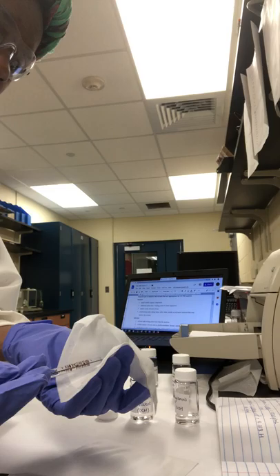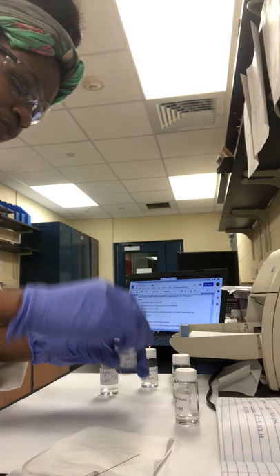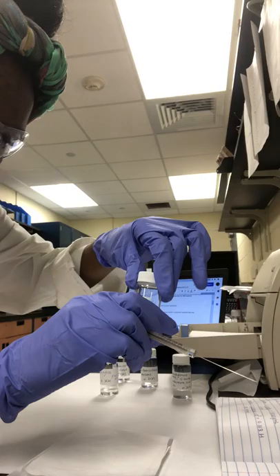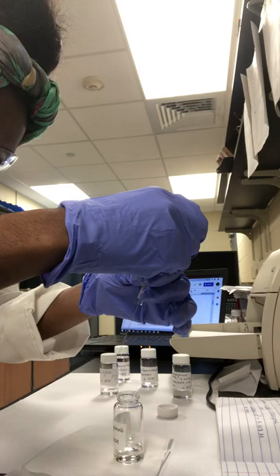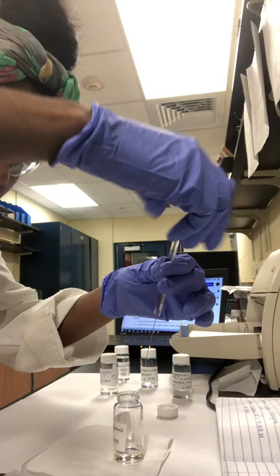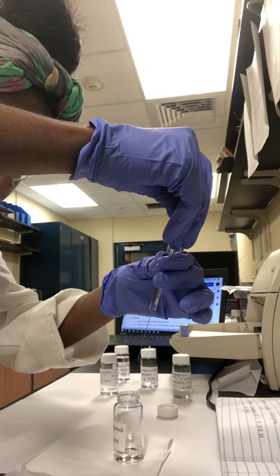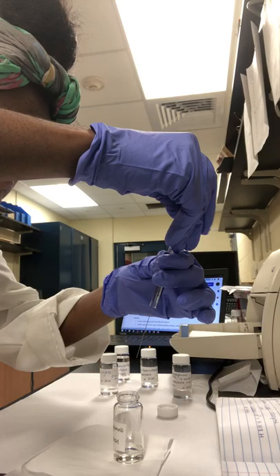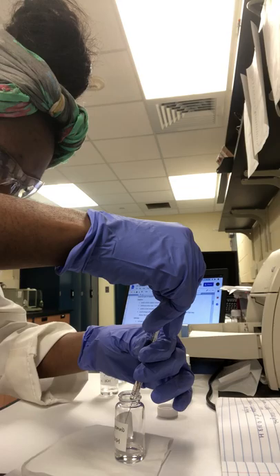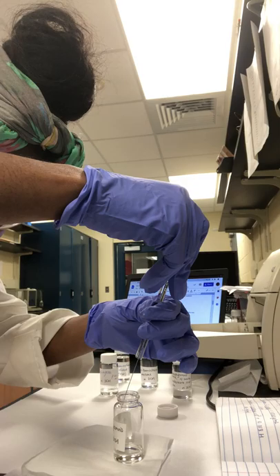Now we're going to use a kimwipe to wipe the needle so that we don't have any solvent residue. Now we want to pull up our actual sample into the syringe. In this case I'm going to use my nitrogen-containing compound. First I'm going to pull up some air into the syringe. The purpose of this is so that when we inject our sample into the injection port, our entire sample goes into the injection port. So we pull up a few microliters of air, and then we're going to pull up one microliter of our sample into the syringe.